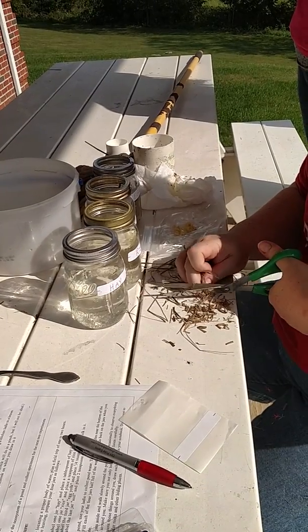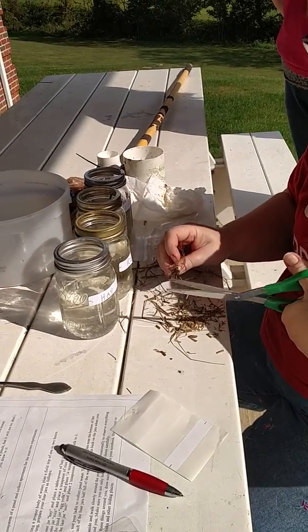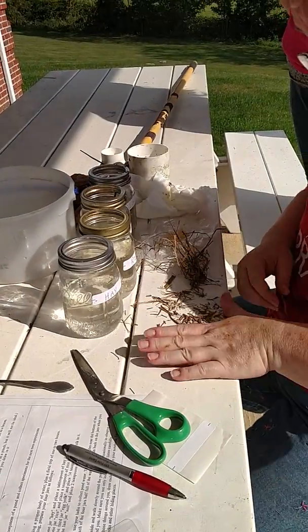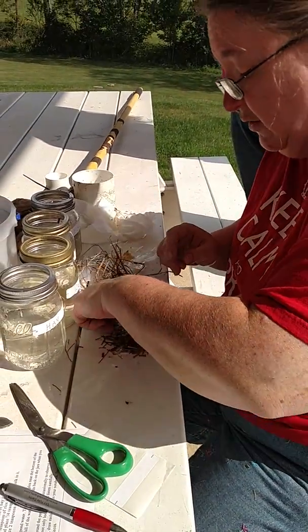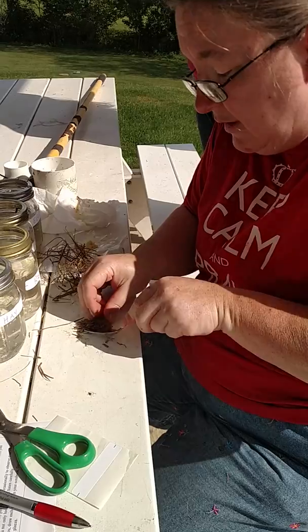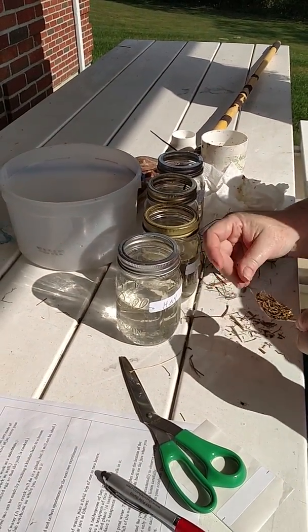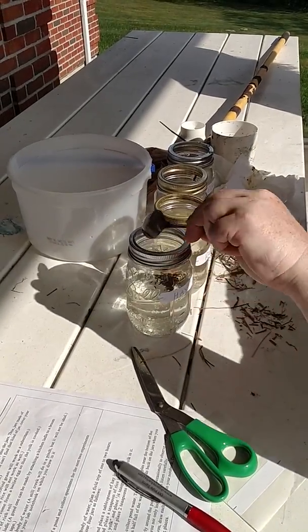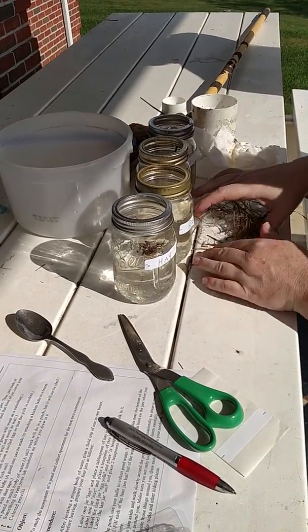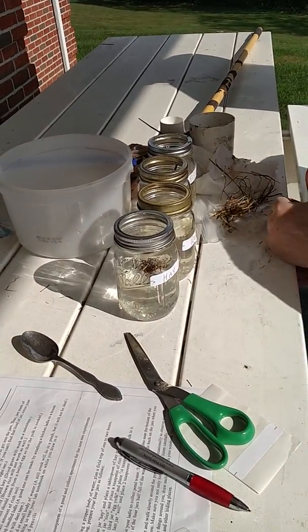You also have a lot of organisms on hay, like bacteria. Are there protists that will eat this material? The answer is yes. You have some that will feed on the cellulose part and actually have the means to break it down. I've got a teaspoon of hay — I'll pull out some of the longer bits — and drop it in there. It'll float for now, but after a while, once it gets waterlogged, it'll sink. And anyway, if it doesn't, it doesn't matter, because protists can swim and they'll be able to go from place to place.